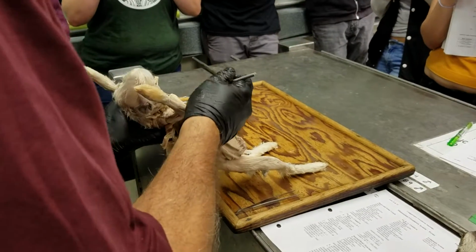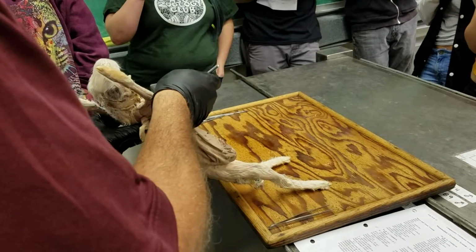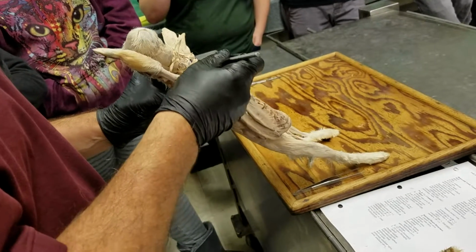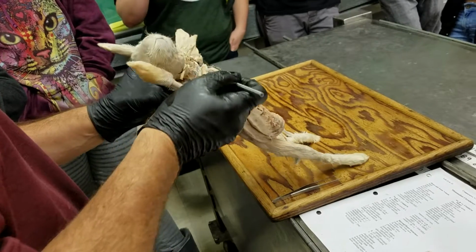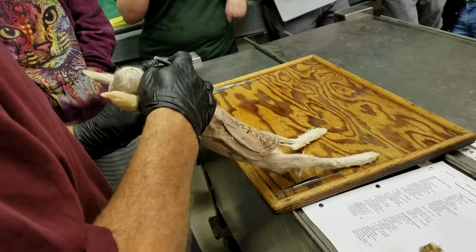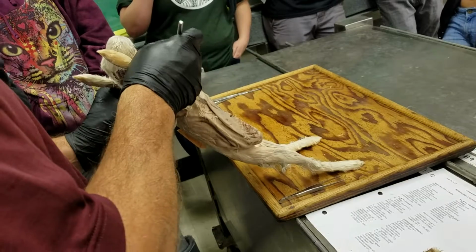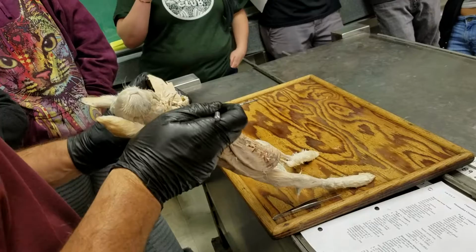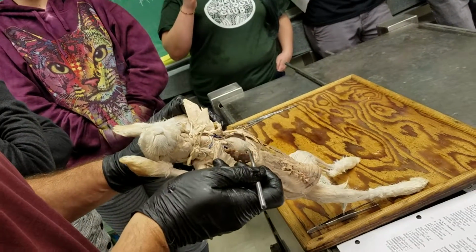But we looked at the heart and found the heart, and the heart has a tip that points caudally, and that's called the apex. And then the part at the cranial end, where all the vessels are coming and going, would be the base. Which seems kind of weird, but that's just how it's called. And there are two small chambers at the cranial end, which are the right and left atria, and then more caudally, the right and left ventricles.